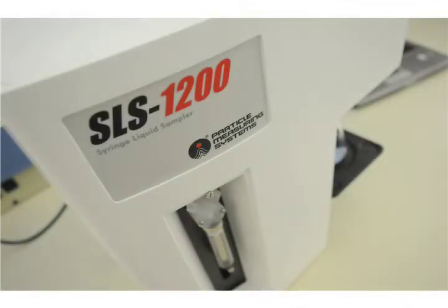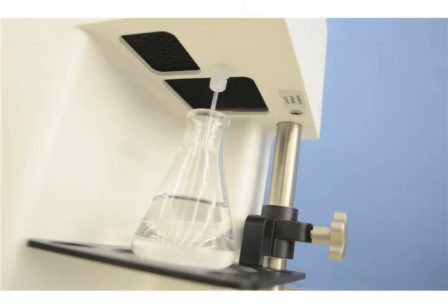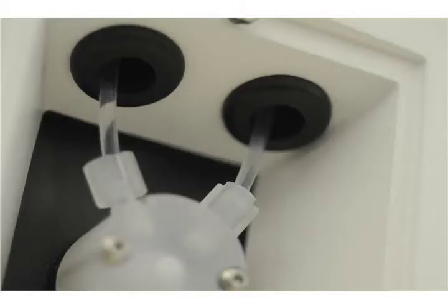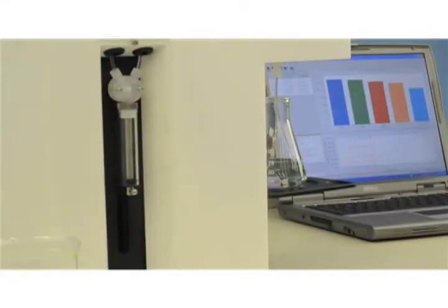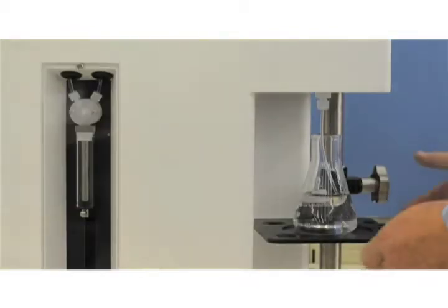Cleaning the sensor capillary should be a rare event. Good practices include flushing dirty samples immediately after completion of the measurement with plenty of clean water, never allowing the capillary to dry out by keeping clean water in the sample cell, and using care when switching between fluids so as not to create chemical reactions in the flow path.